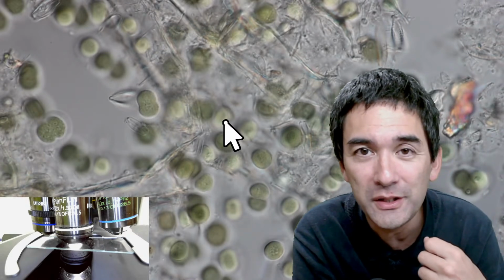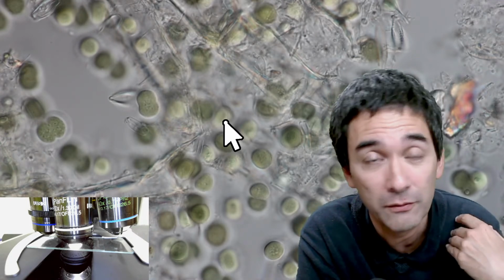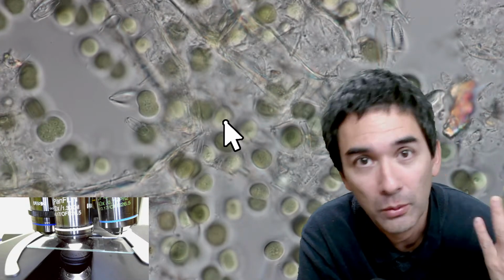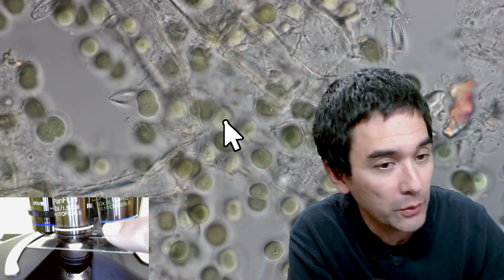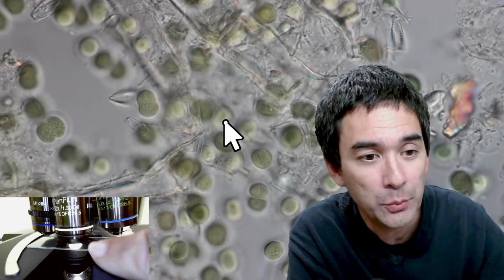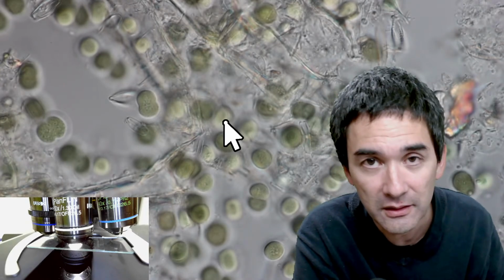So as a mounting medium, you can use, I've used, for example, regular vegetable oil, cooking oil. Or you can use the more expensive immersion oil. But for oil immersion microscopy, for the oil between the cover glass and the objective, only use dedicated immersion oil.